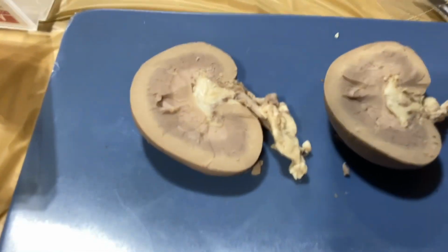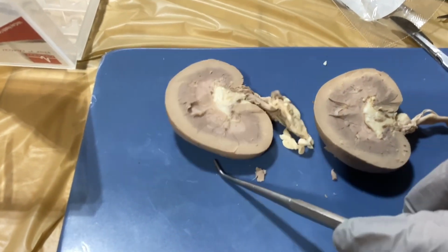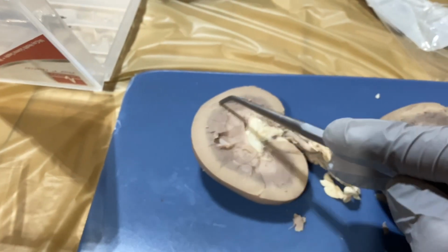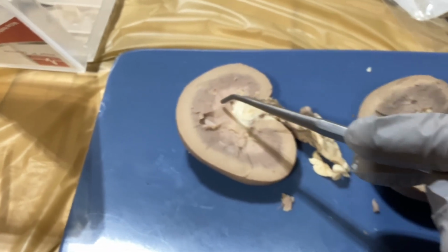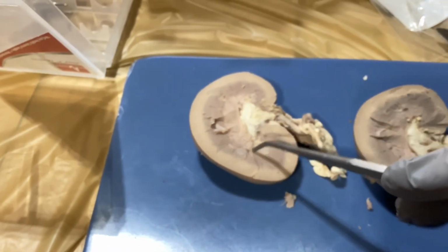Okay, and then we have our renal capsule, which is going to be the outer side of our kidney. So it's going to be all around on both sides, this guy. Next, we have a couple things. We're going to have the renal cortex, which is going to be this lighter part right here. And then we're going to have the renal medulla, which is going to get into this darker area right here, which is also going to lead into this pink area, which we're going to have all our little pyramids in.